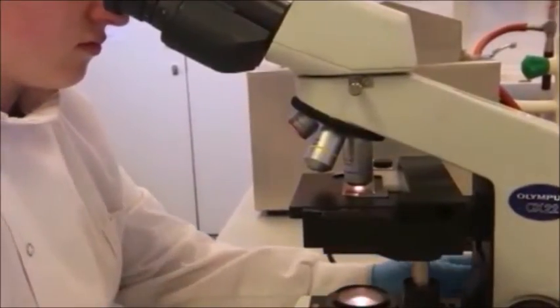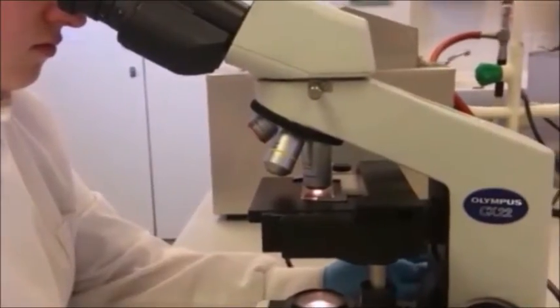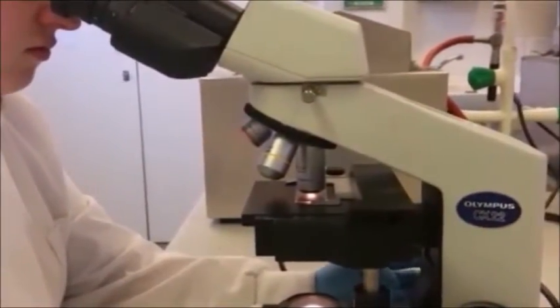Adjust the diaphragm to let as much light on the specimen as possible at each magnification.